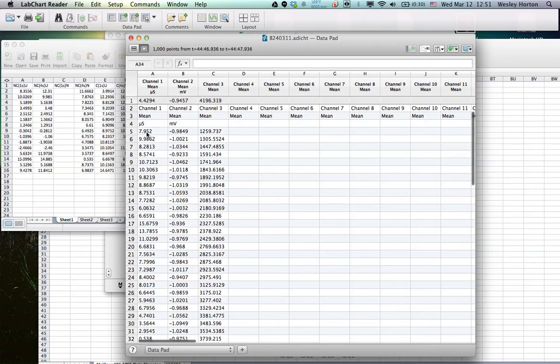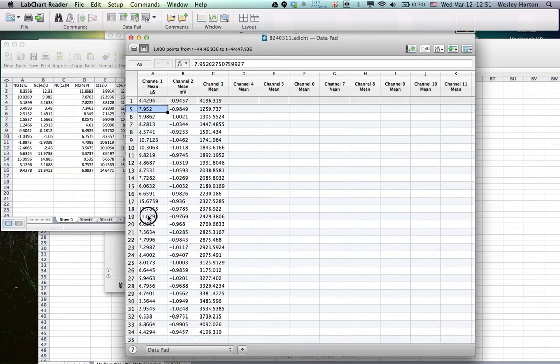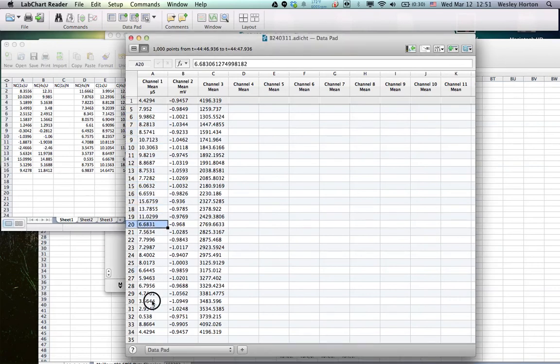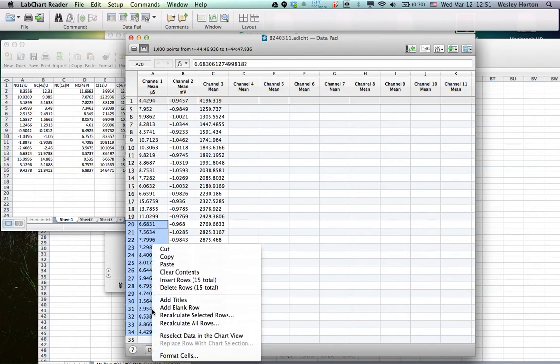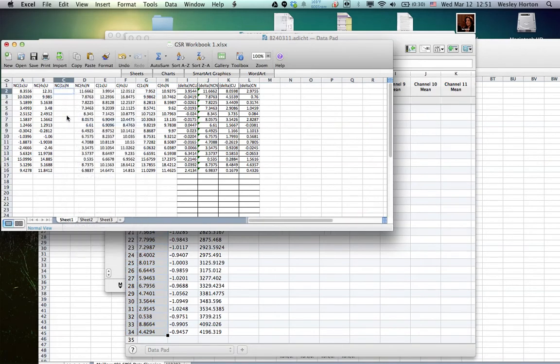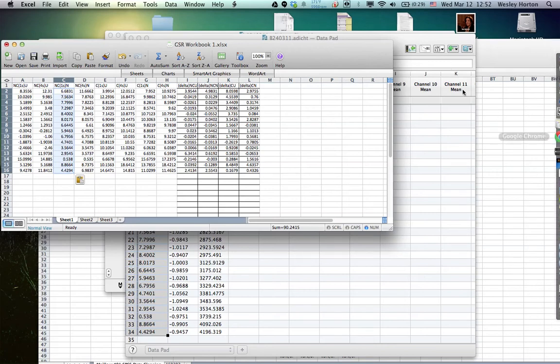Alright, so the first 15 again is going to be SIBS. And the last 15 are going to be non-SIBS. Alright. So right now you could actually go in and get the data points for the non-SIBS and SIBS, but it's pretty easy and pretty straightforward. It's the same process and you use a different data file. So I'm just going to continue on this.